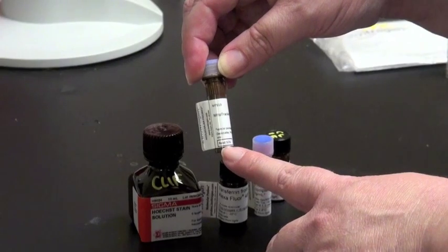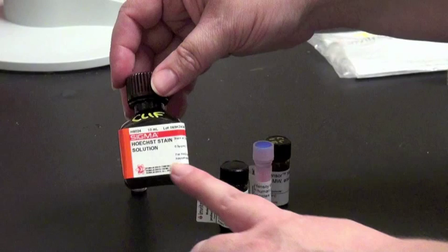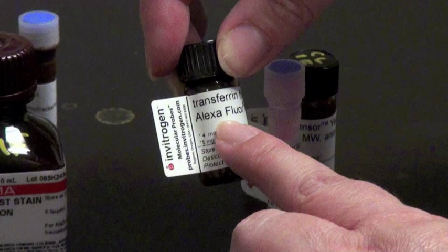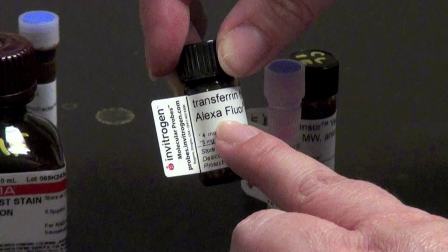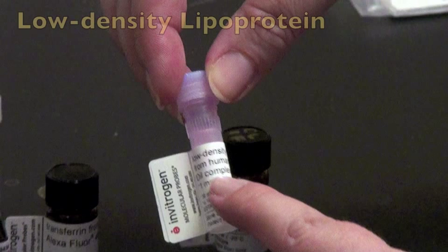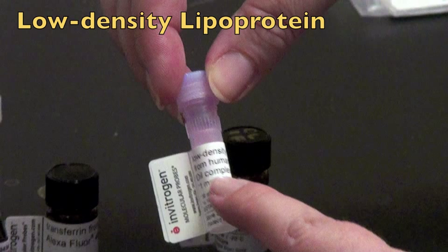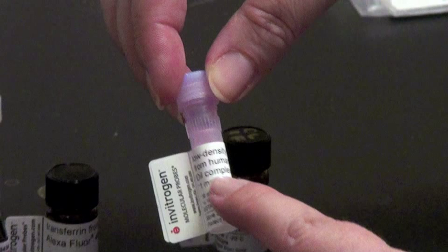So you want to make sure you're really reading how to use your stain properly to get the best results. Some other options for staining the nucleus with live cell imaging include Hoechst stain solution. You can also label different vesicles, watching things move in and out of the cell. For example, this is transferrin labeled with Alexa Fluor 488, which will allow you to watch transferrin receptor uptake. This is low-density lipoprotein complexed with a red dye called DiI, which is great for watching trafficking in cells.